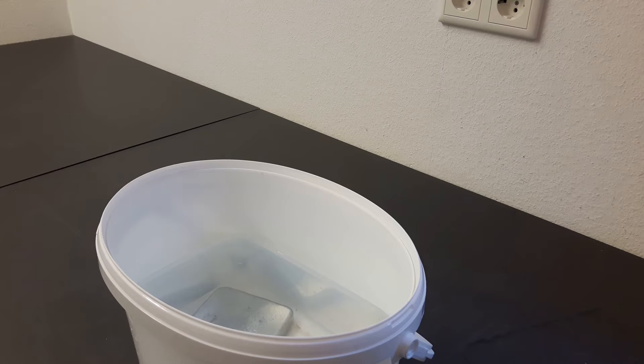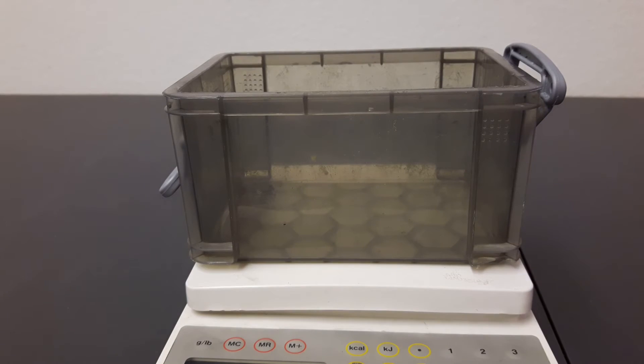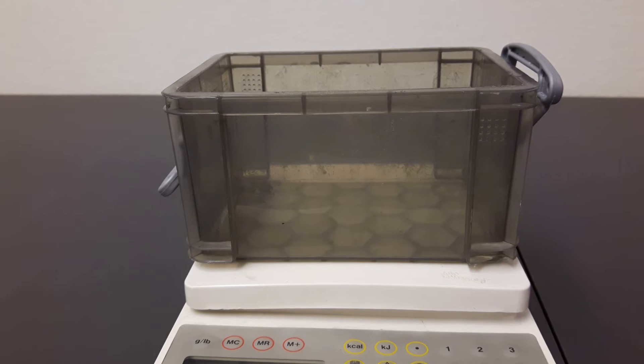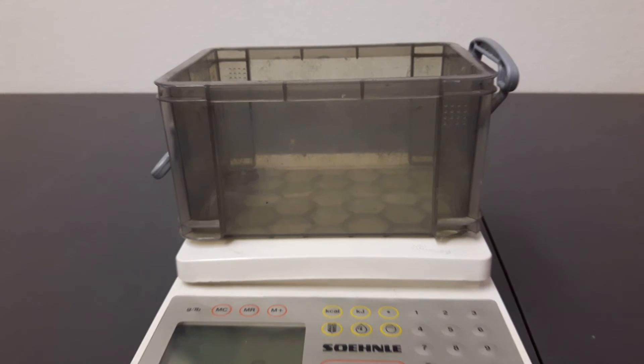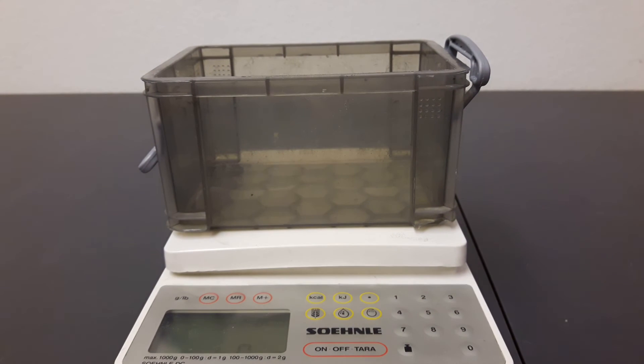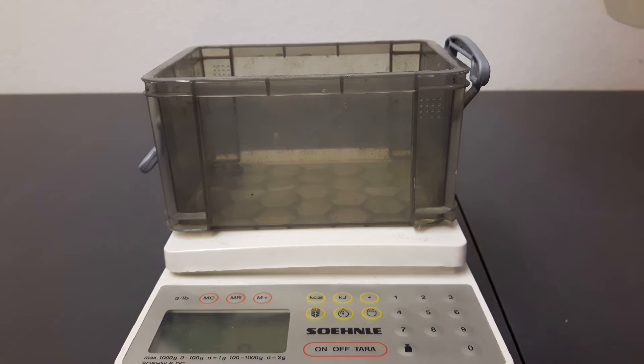Finally, the water in the bigger bucket is taken and weighed as well. The density of water is nearly 1, so its mass in grams equals its volume in milliliters, because the water was pretty cold.